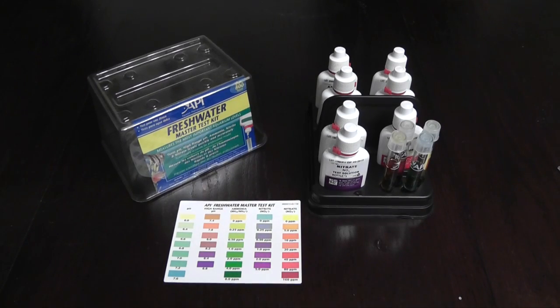All right y'all. Now that you've waited about five minutes, let everything settle in your test tubes. Now you're going to check to see what your levels are.